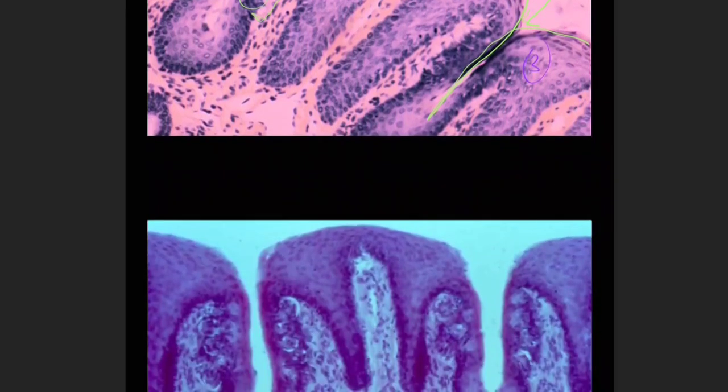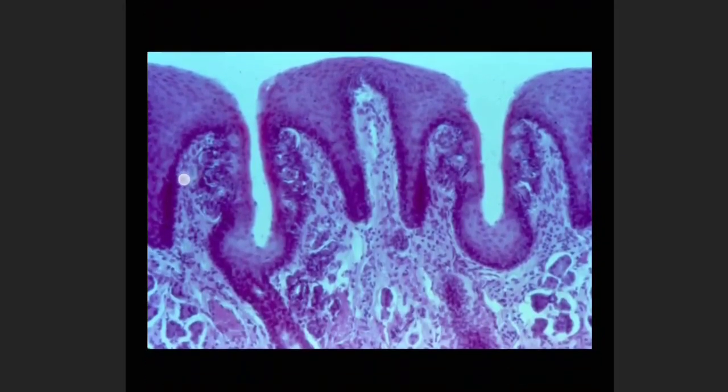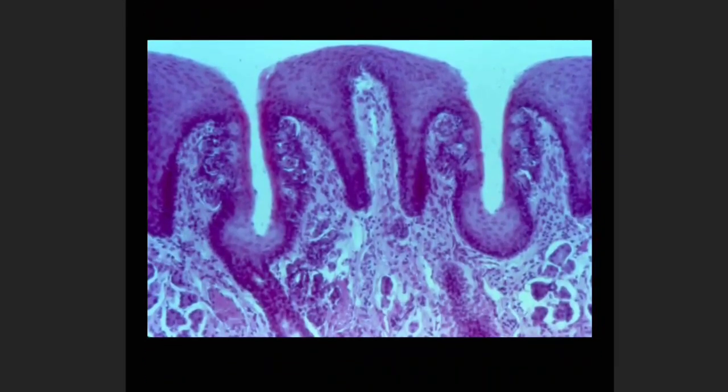We have another example. To study this, I recommend pulling up many different examples of taste buds so you can get used to them. The reason you want to practice with different slides is because we do have different shaped papillae. Depending on the type, it's going to look more mushroom shaped. It might look more block-like, like this one. So make sure you're comfortable with the different types of papillae we might see with taste buds.